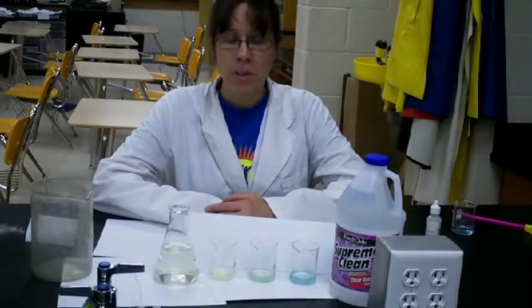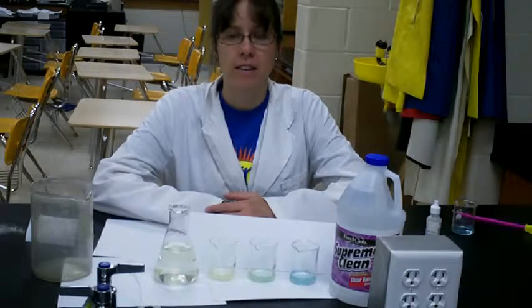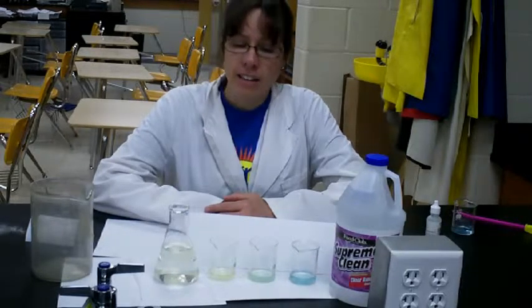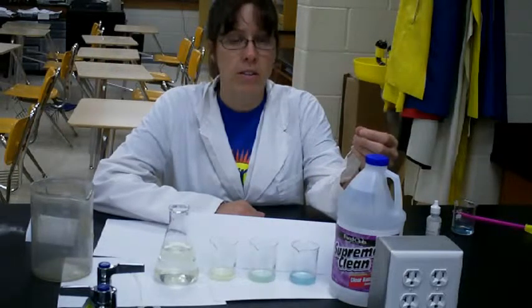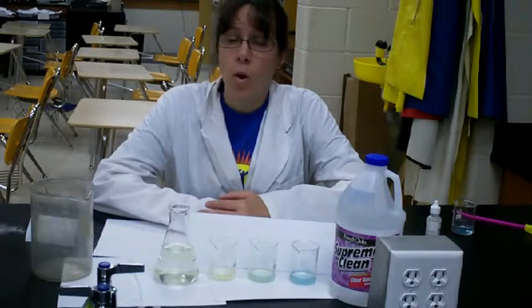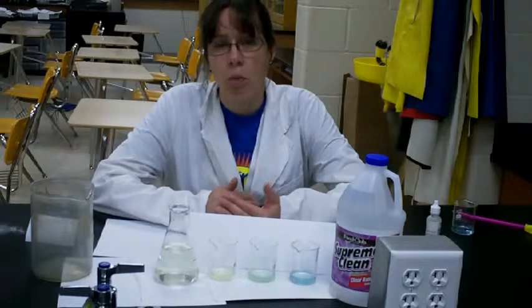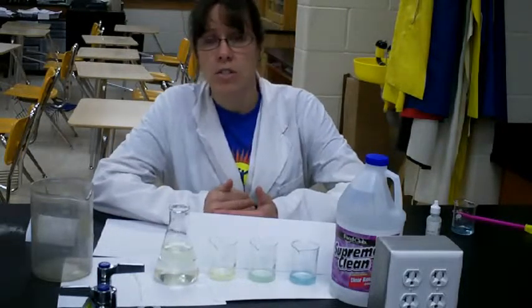Here to take one more look at a couple of tricky points of the Global System Science sampling carbon dioxide experiment. And at the end of this experiment, you are going to be moving from doing a qualitative comparison, just comparing the color changes to one another, to a quantitative comparison, actually putting a number on how much carbon dioxide does each sample have relative to the other sample.